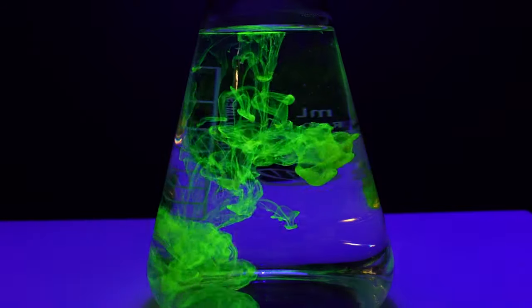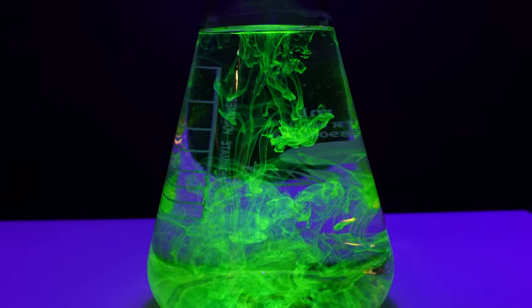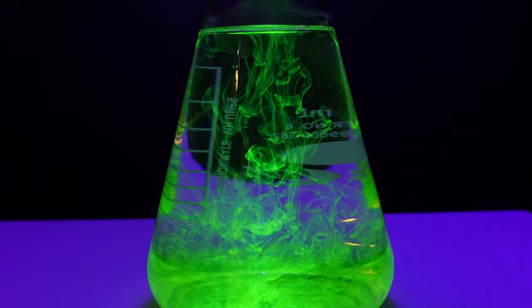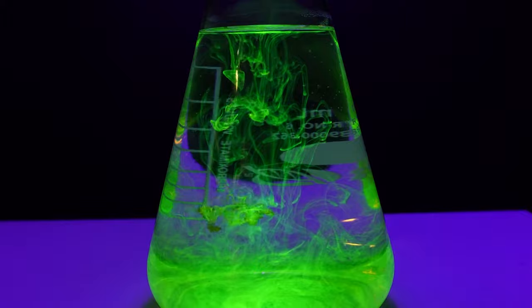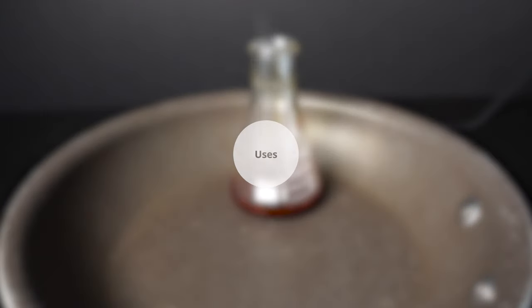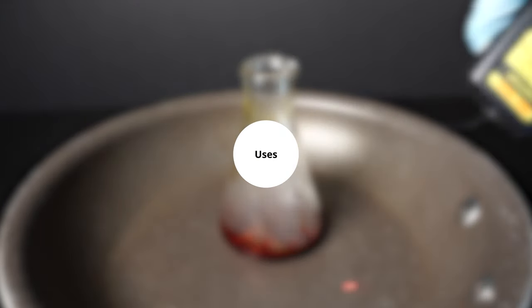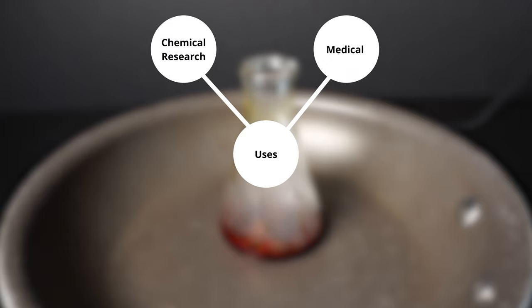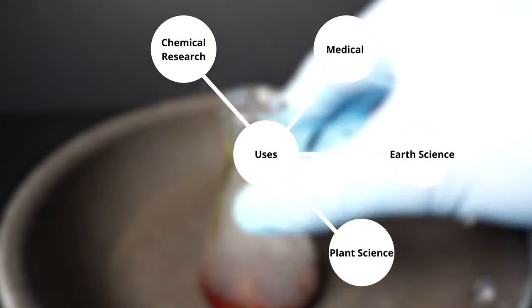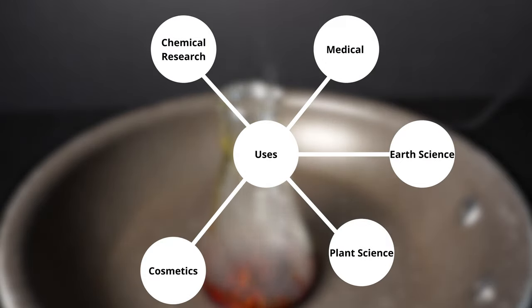In today's video, we're going to be making fluorescein and then talk a little bit more in depth about it. Fluorescein is an extremely interesting compound because it has so many uses across multiple industries, from chemical research, medical uses, studying earth and plant sciences, and even in cosmetics.